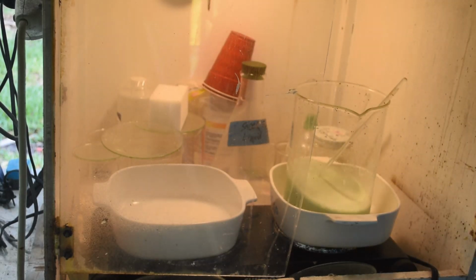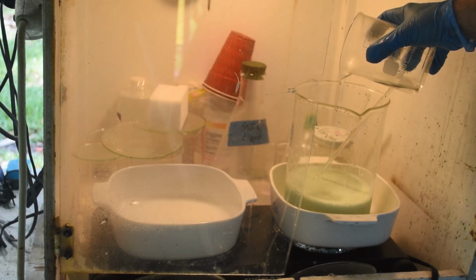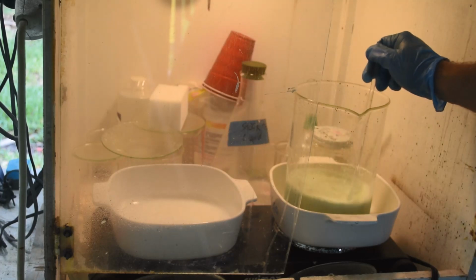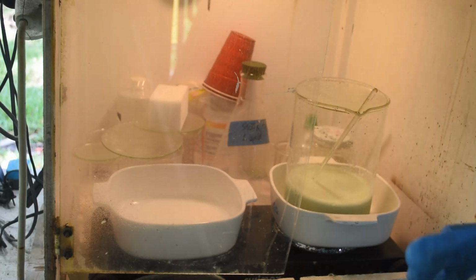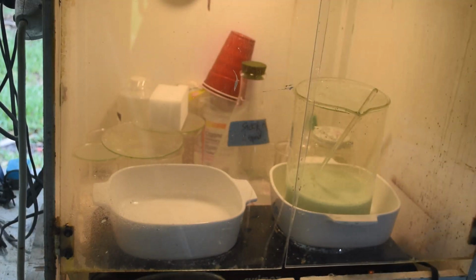Alright, so this thing has had a chance to calm down. It's cooled down. Let's put a little bit more acid in it, tickling the tail of the dragon again here. Just a little though. Not going to put any more in right now, being mindful of delayed reactions. Turn the heat back on. And there we are, we're back in business after that slight boil over. Okay, let's let this heat up again and continue reacting. But we're definitely getting some metal in solution. The color tells me that.